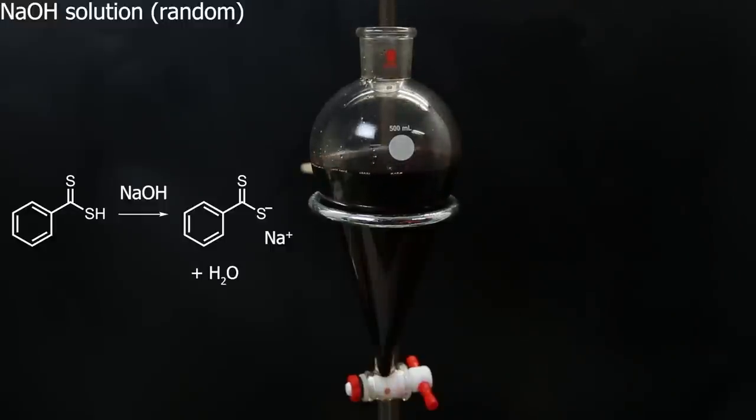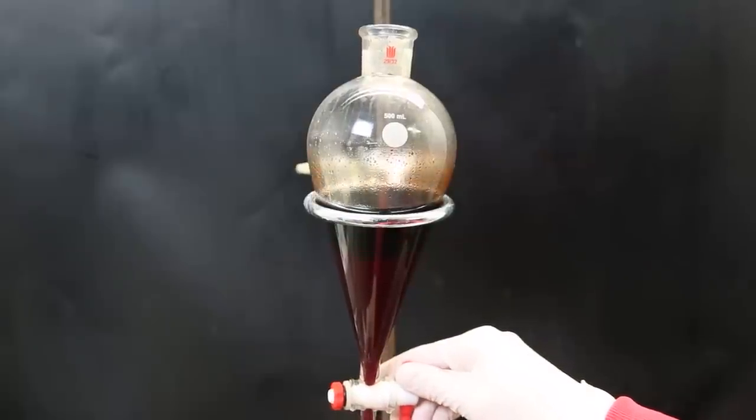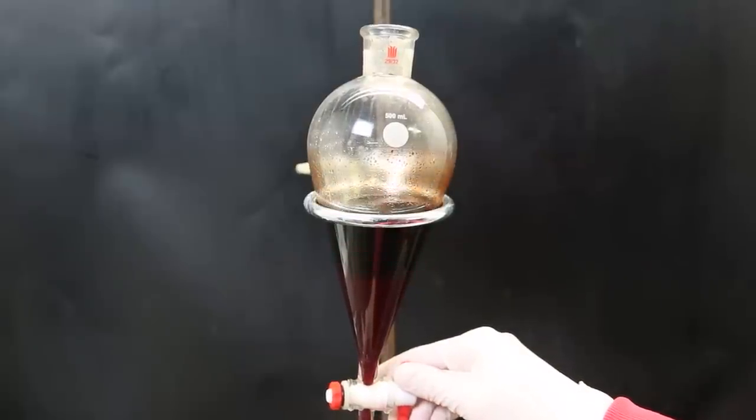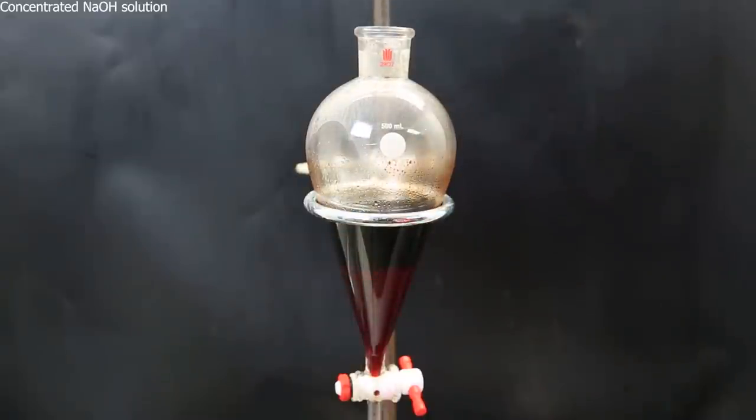It was very difficult to see the separation, both in real life and on camera, so I increase the exposure, and we see the two layers. Since it was so difficult to see, I didn't drain the water layer completely. I then add more sodium hydroxide solution, to take out the rest of the product.